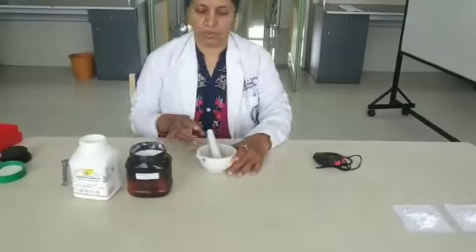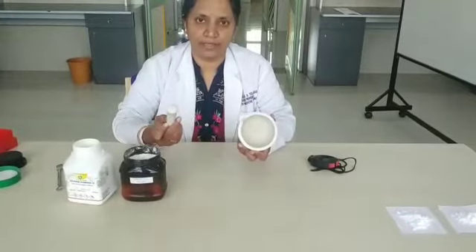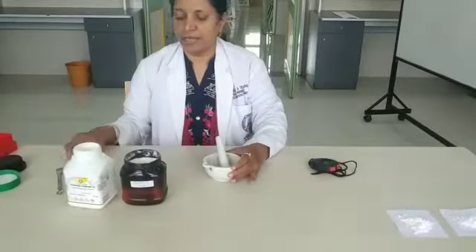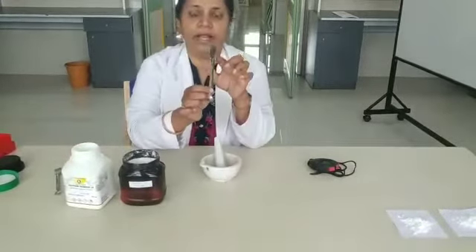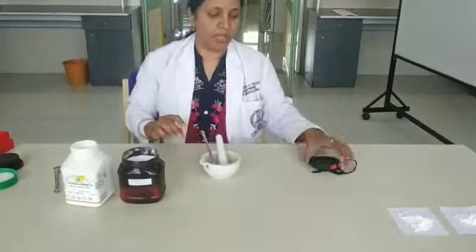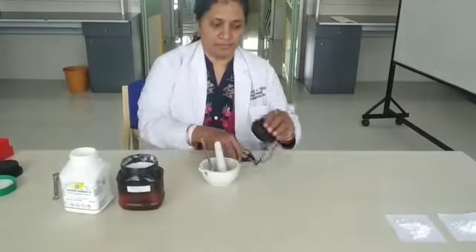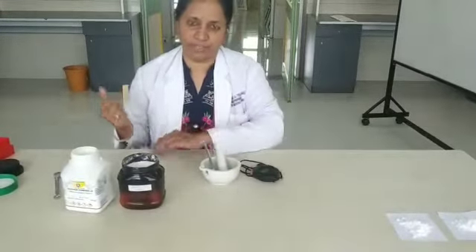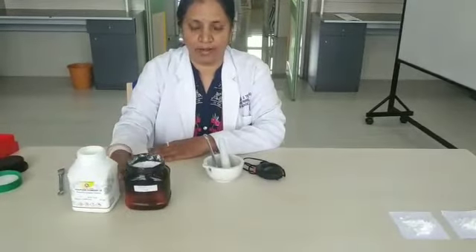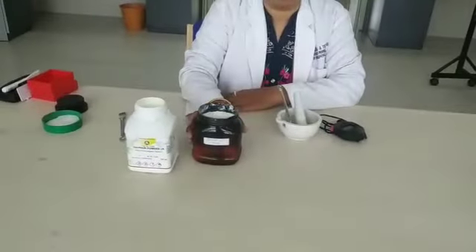The requirements — the instruments required are a porcelain mortar and pestle, and a spatula with a blade end as well as a spoon end. There is also a stopwatch to monitor the timings, and a weighing machine for weighing the drug substances.